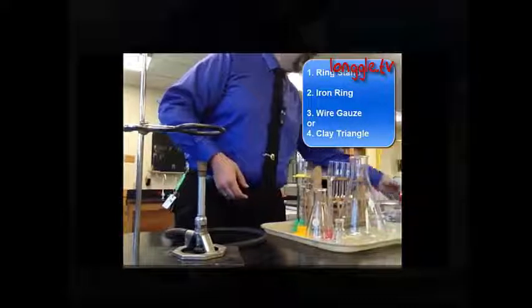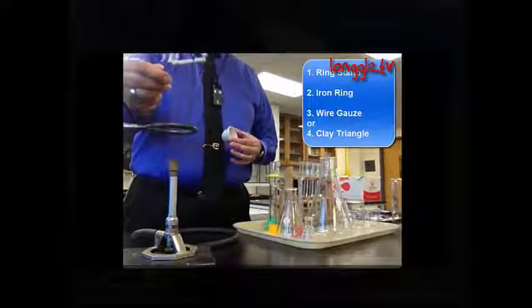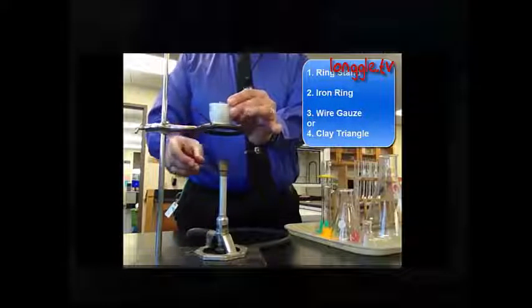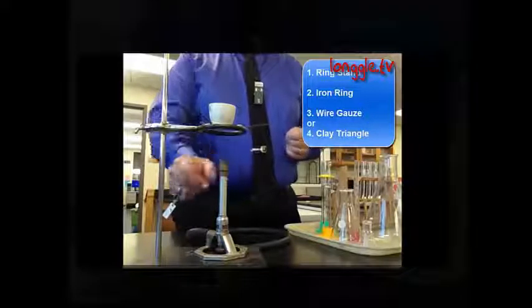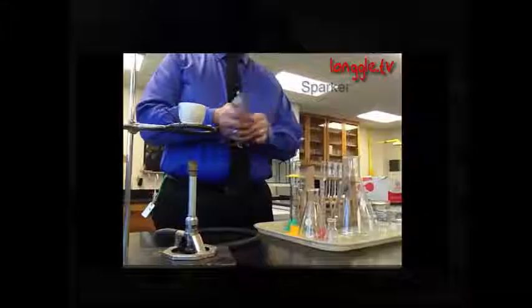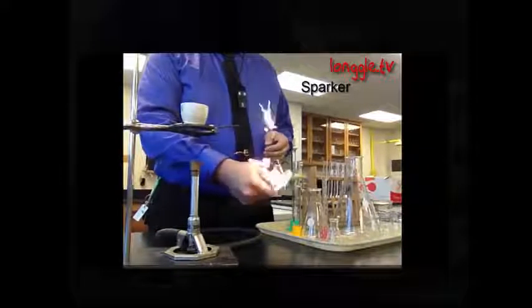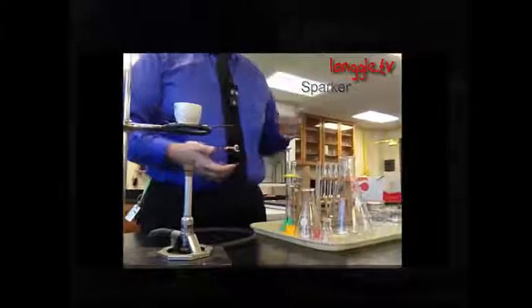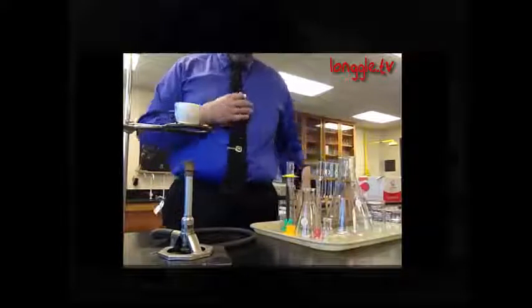We can use something called a clay triangle. This is a clay triangle, and that actually holds the crucible rather nicely right in place if we wanted to heat the crucible. When it's time to light the Bunsen burner, I use a sparker. This is a sparker. It creates a little spark, and I can light the Bunsen burner. Again, you'll see this later on when we show you how to light the Bunsen burner.